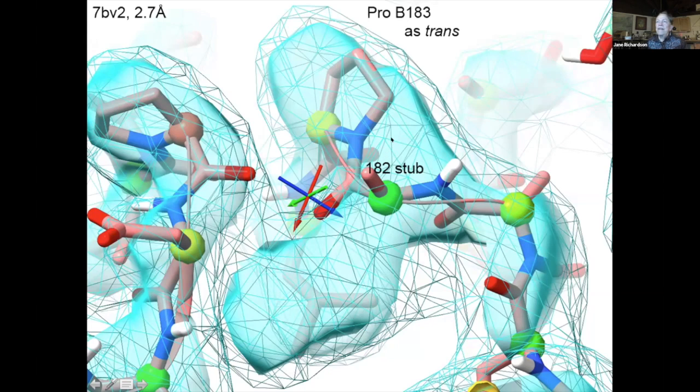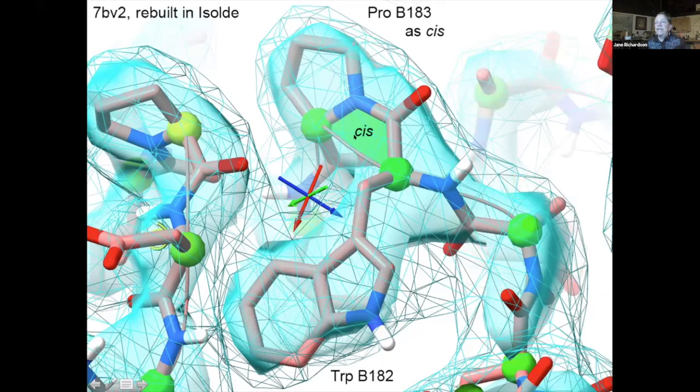So for instance, one of the examples in one of the SARS structures that we worked on collaboratively is a place where what should be a cis-proline had been fit as trans. And this meant that the tryptophan right next to it could not be fit into what is this obvious tryptophan density. And so they actually truncated it at the C beta. And if you change it to cis, then it just slides right into that gorgeous density. So if you're having real problems with your structure, you might want to learn how to use Isolde.